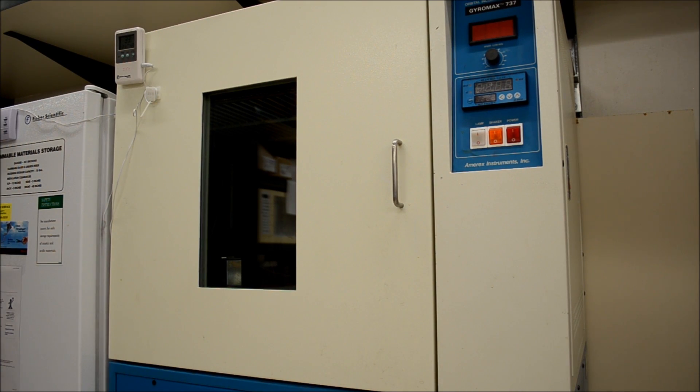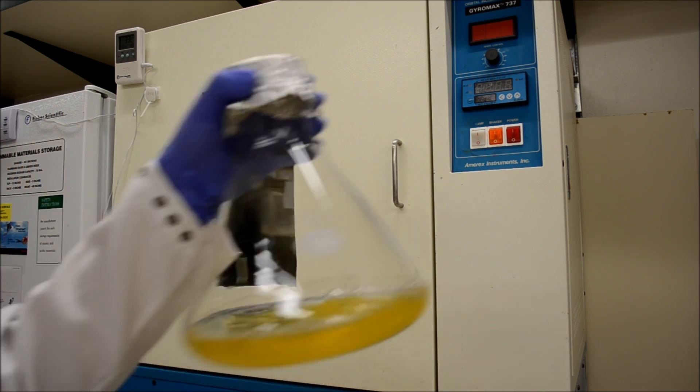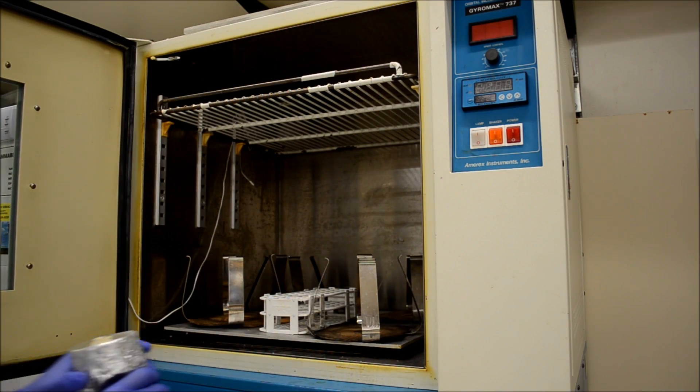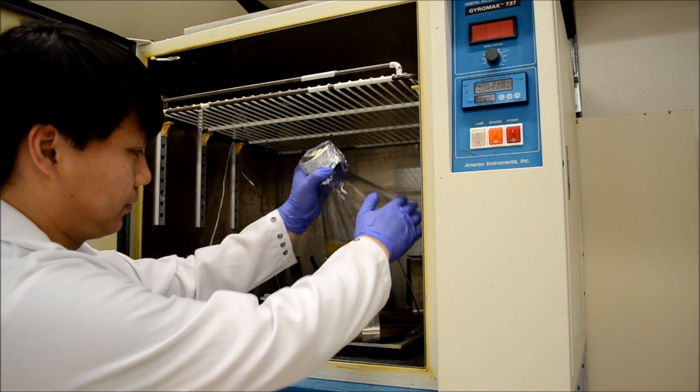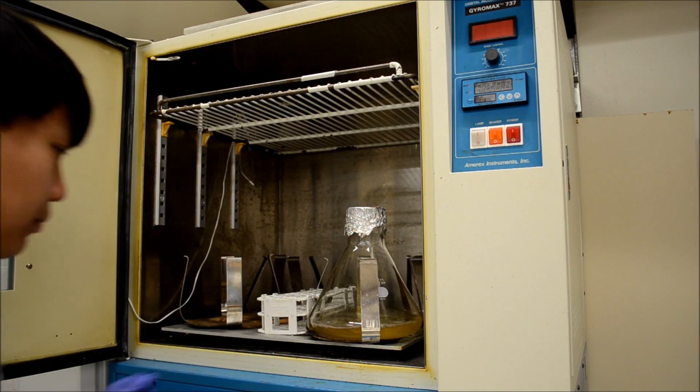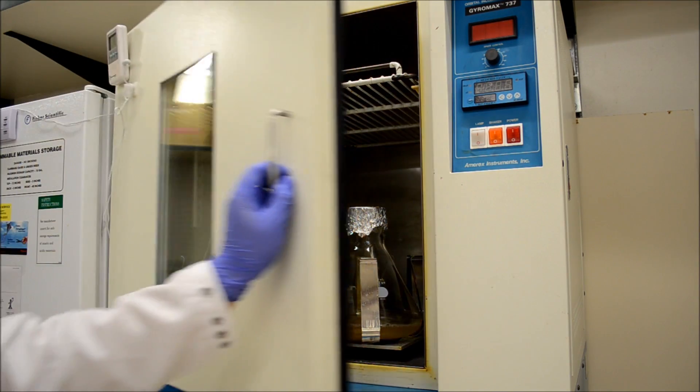Next, you will place your bacterial culture into an incubator. In the incubator, the bacterial culture will reach 37 degrees Celsius. The incubator will also shake the solution to induce bacterial growth.